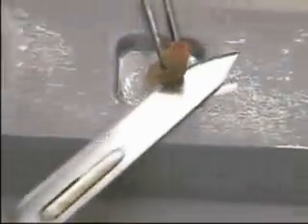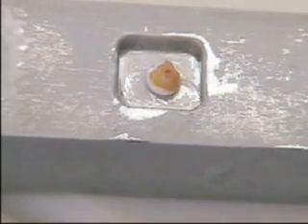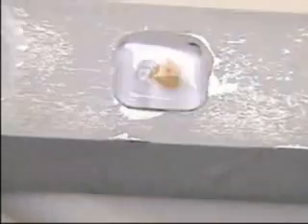Now we hold the tissue with the forceps on the other end and cut across it with the scalpel. The result is a 3 mm section with the desired face adhered to the floor of the well and kept oriented.